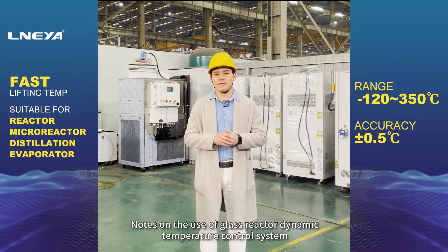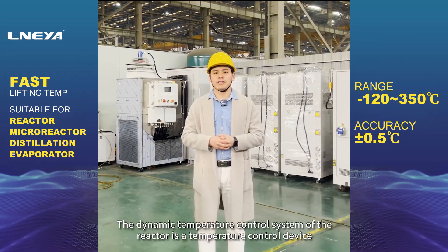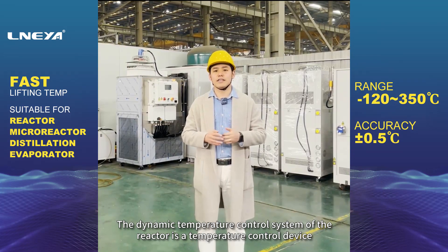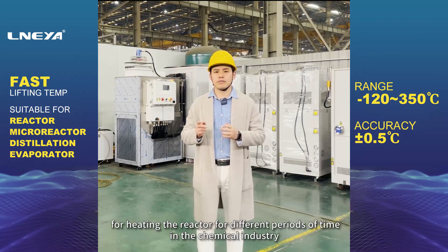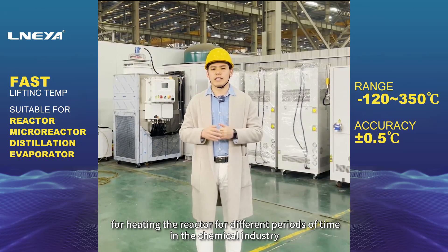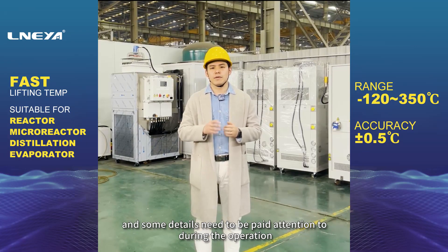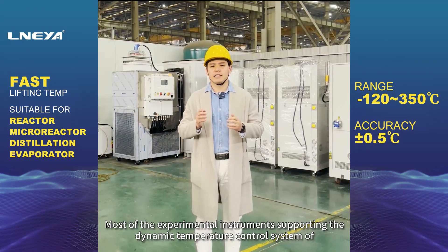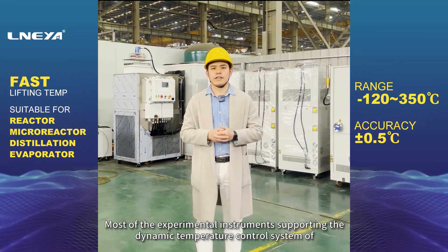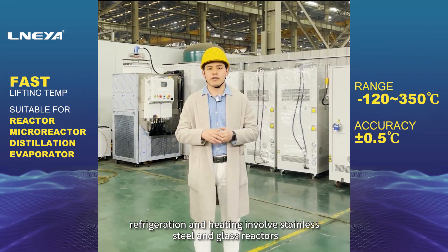Notes on the use of glass reactor dynamic temperature control system. The dynamic temperature control system of the reactor is a temperature control device for heating the reactor for different periods of time in the chemical industry, and some details need to be paid attention to during the operation. Most of the experimental instruments supporting the dynamic temperature control system of refrigeration and heating involve stainless steel and glass reactors.